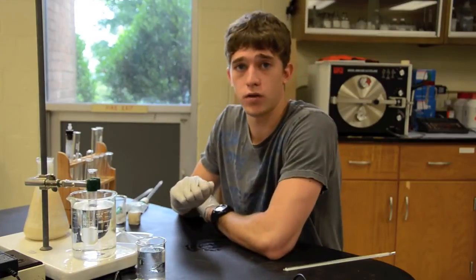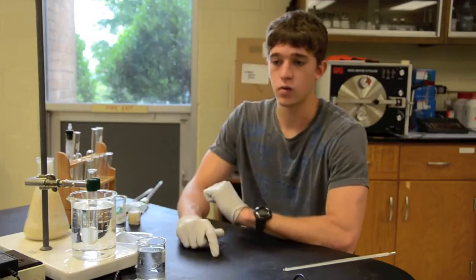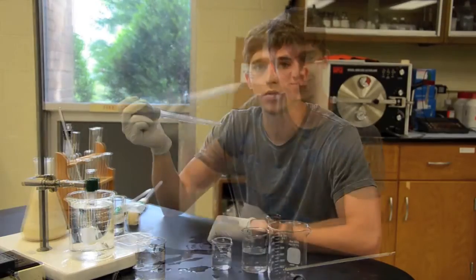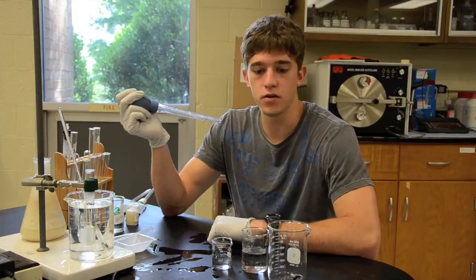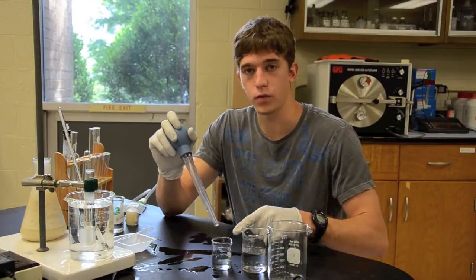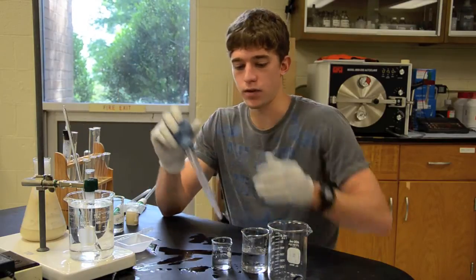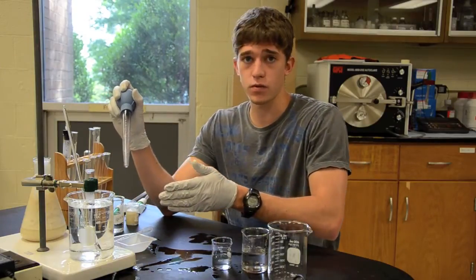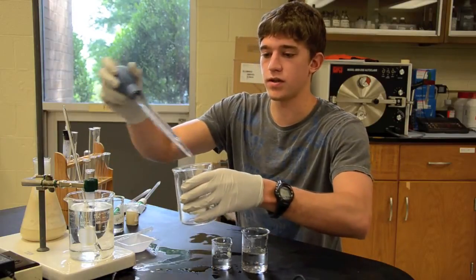It's going to be at 40 degrees no matter what, as long as we keep the water at 40 degrees. To do that, we will need to use the turkey baster recycling water in and out. It's important to ensure that our water stays at 40 degrees Celsius. I have a beaker filled with warm water that we heat in the microwave and a beaker filled with cool water from the tap. We must remove some of the liquid first so that we don't overflow it — just take some out with the turkey baster and put it into this empty beaker.